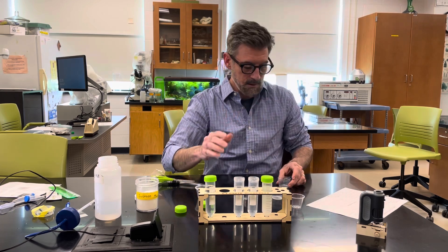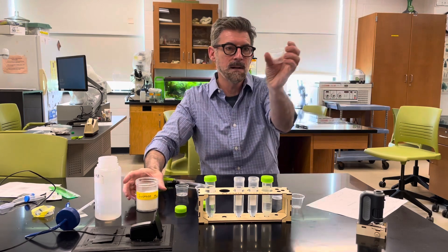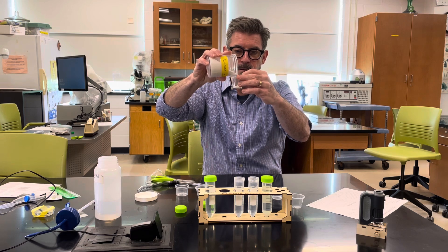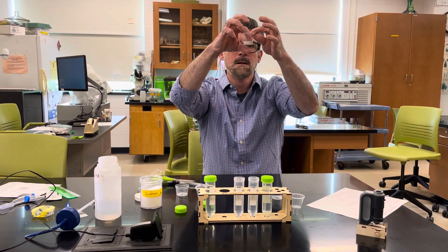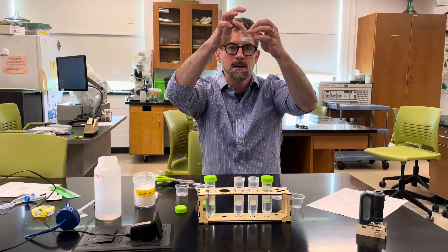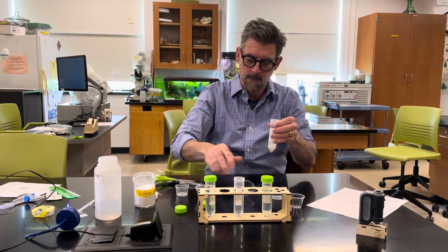The one molar is very concentrated so you may need to mix it again. For the 0.5 molar solution, you need 7.5 milliliters of sugar — that's halfway between the 5 and 10 marks on the measuring cup. Add that sugar to the tube labeled 0.5 molar and cap it.